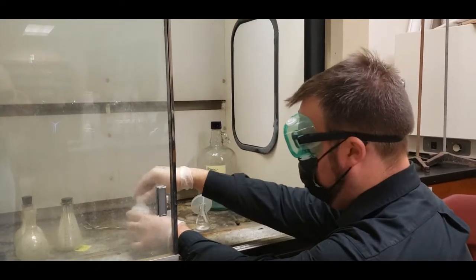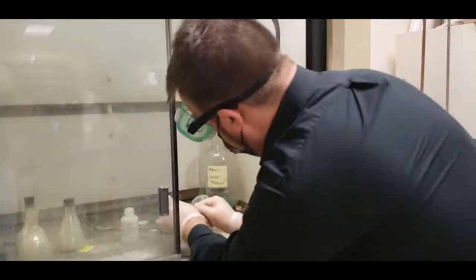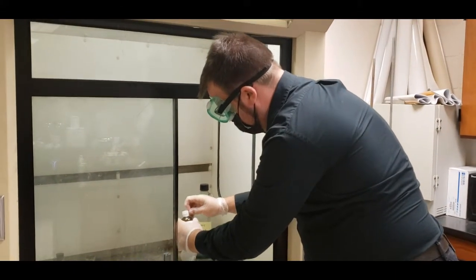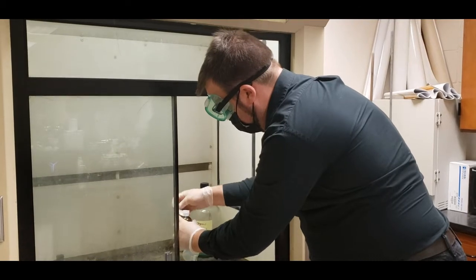We will close it up. And now we are going to go ahead and add in our drops of sulfuric acid.